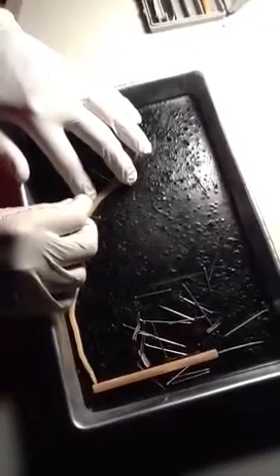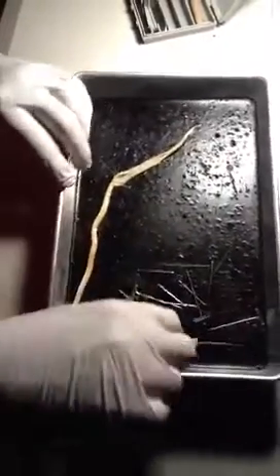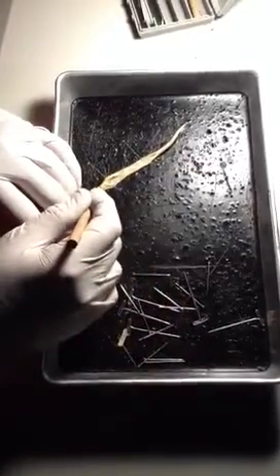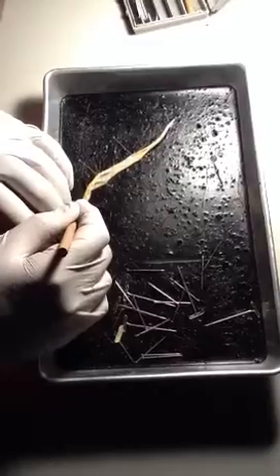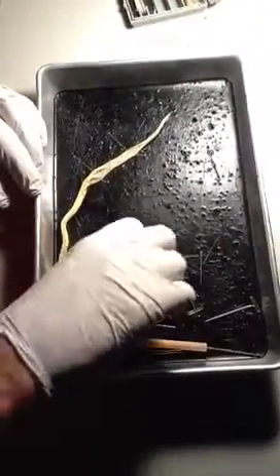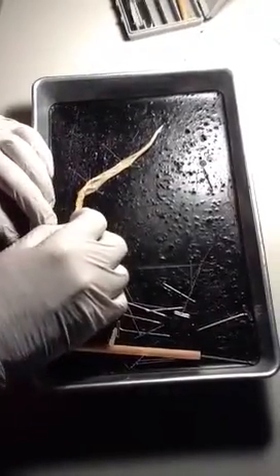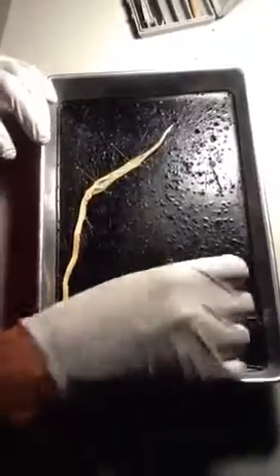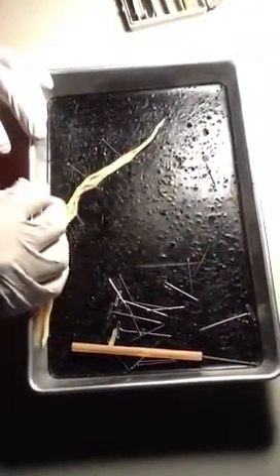I sing when I dissect — I don't know why. I should have probably put it more in the middle of the tray, but so goes life. You'll find I don't get real upset and rattled about the dissection. I've gone about halfway down the worm, and that probably is actually plenty far enough because I can see everything you need to see here.